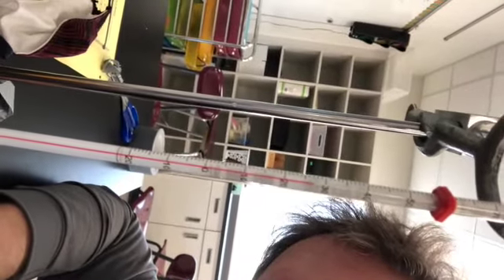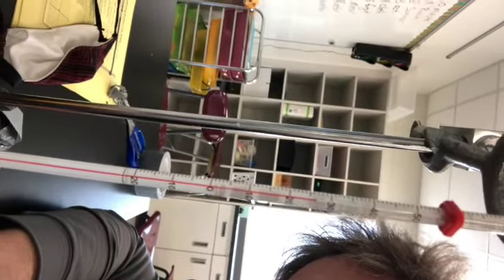All right, another 5 minutes. Let's take a look at what our water looks like now. Pretty much the same as before. We still have some solid in there with some ice, and we still have a little bit of water in there. Let's take a look at our temperature. Oh, our temperature's going up, though. Look, it's almost 30 degrees now. But still not super warm. All right, we'll set our timer for another 5 minutes, and we'll see where we're at.